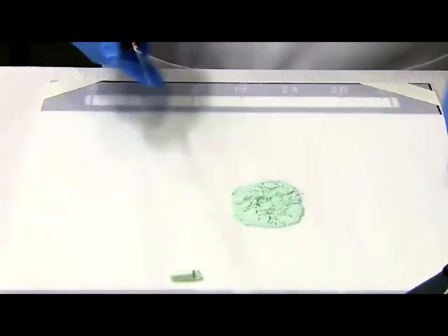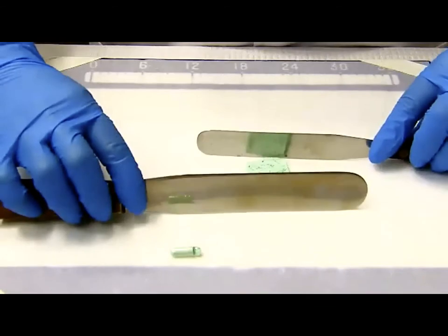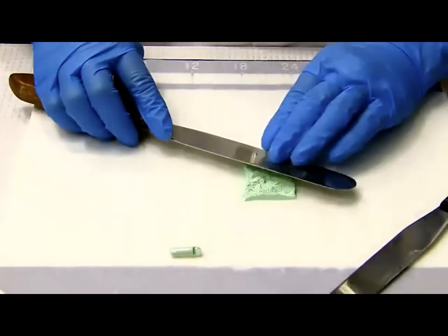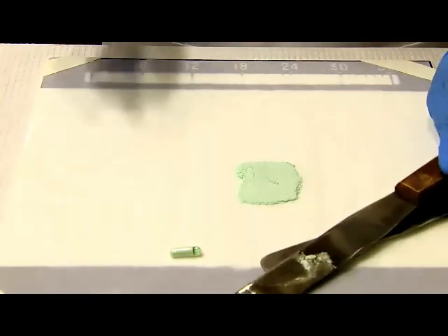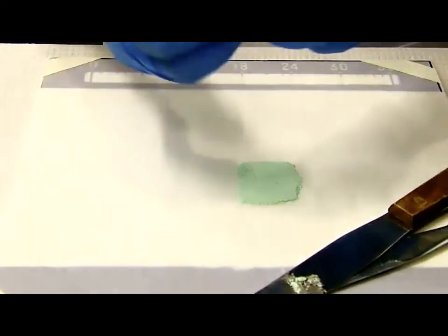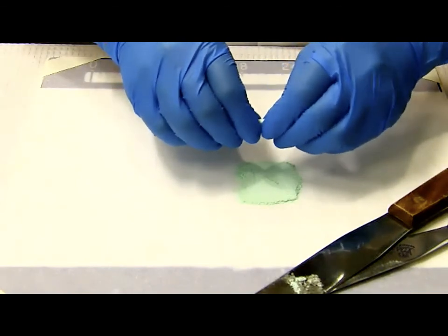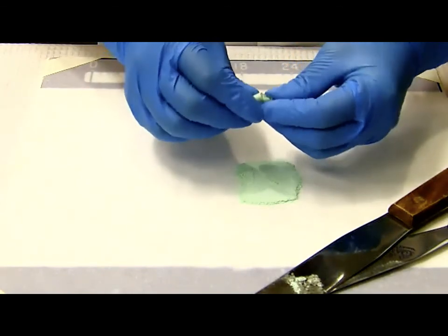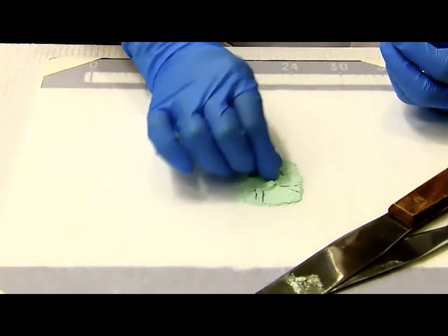But my bed is all messed up. So I'm going to make my powder bed one more time. Grab the powder and press down really hard. Usually, the tighter the powder bed is, the easier when you do punch. The good news is I didn't lock the capsule, so I should be able to easily take it apart. Okay, now let's scoop on the side again and punch one more time.